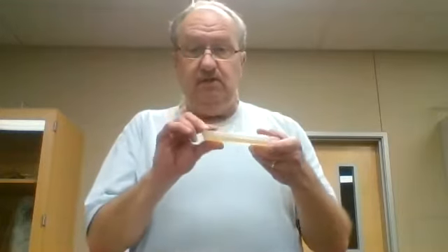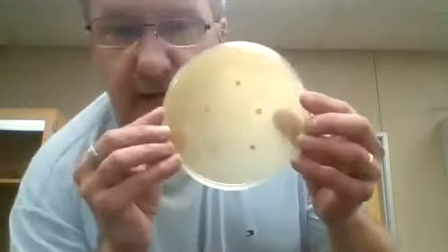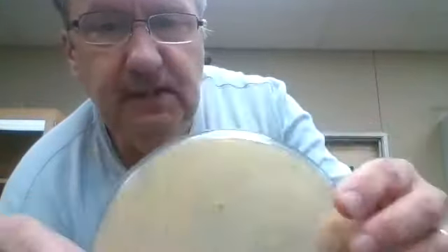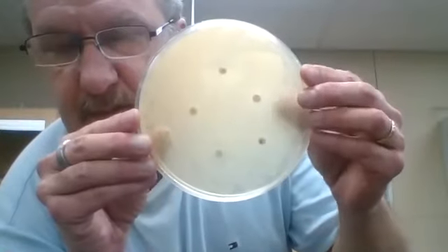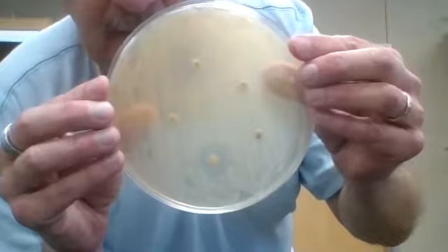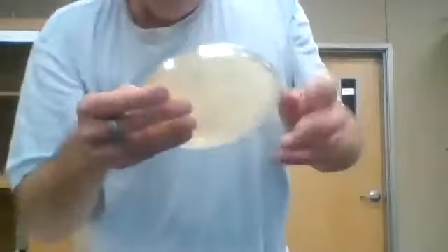And the first bacteria that we're going to look at, we're going to measure the zones of inhibition for these Petri dishes. And I will first just briefly show you how they turned out. You can see pretty much the zones of inhibition there. It's a little bit more difficult to see. Maybe if I get a little lower light, you can see the different zones of inhibition there. It's a little easier to see on E. coli. But for each antimicrobial agent, I'll call out what the zone of inhibition was using my trusty dusty ruler.